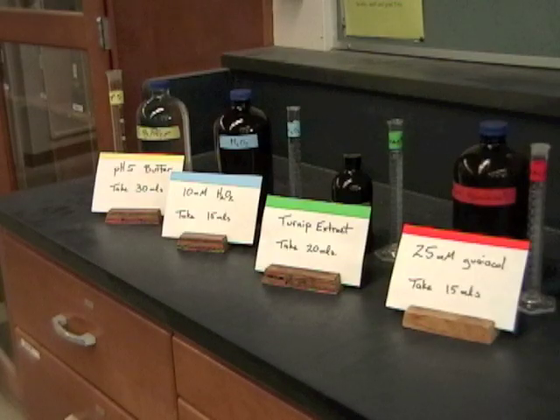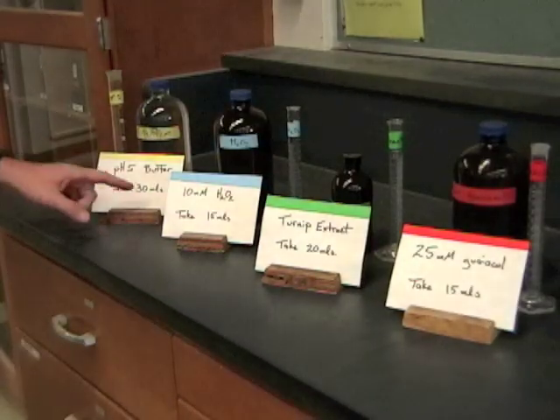Now rather than have everybody come over here and measure out little bits of these, what we want is for one person from each group to come over and get an aliquot - that's a little sample from each of these. And notice that it says on the signs exactly how much you need to take.